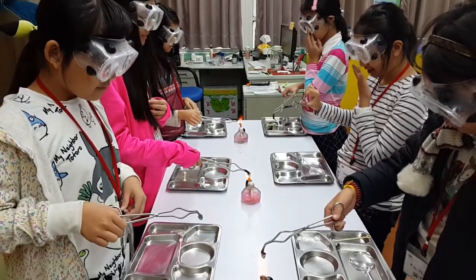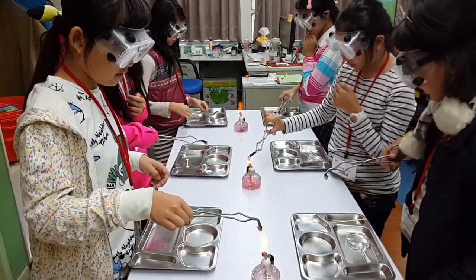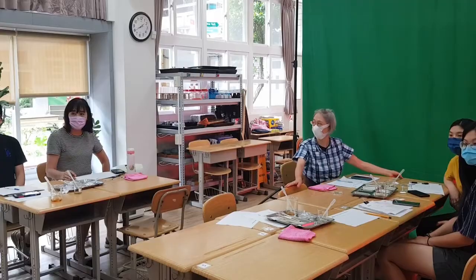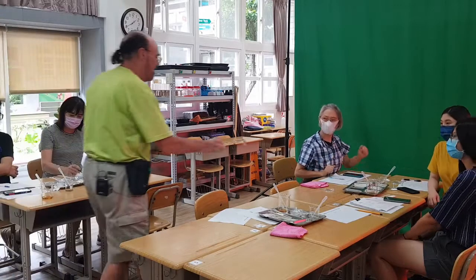Smoky. Okay, I'll take a look. And a little more. And I'll show you. Little brown, black. Bubbly. Smells good. Oh, good observation. So you can write that down for A. Smells good.